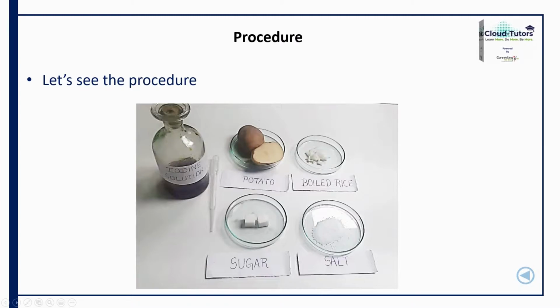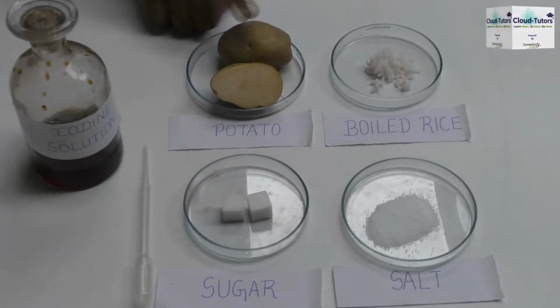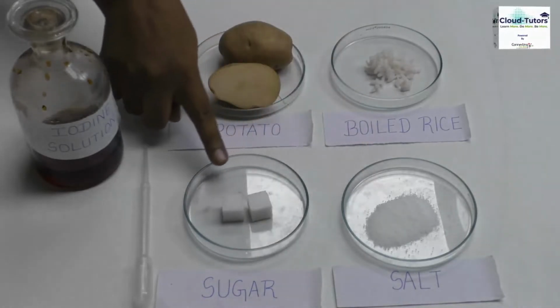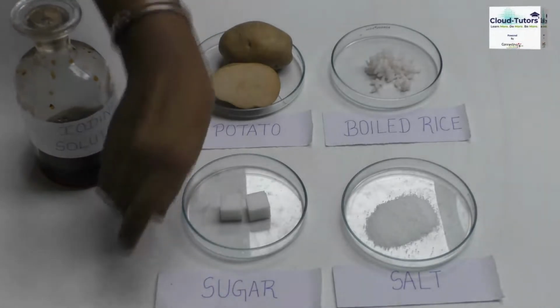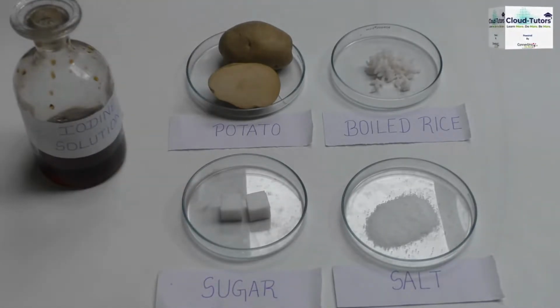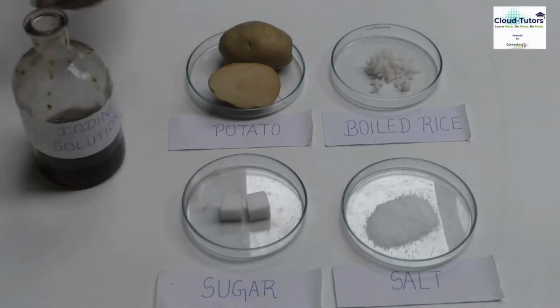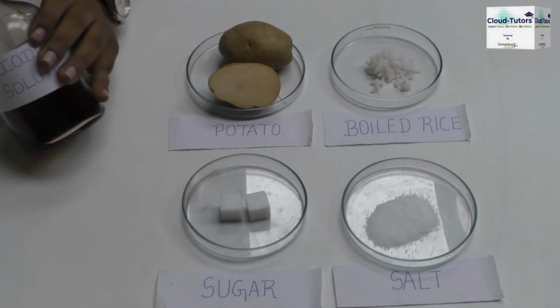We have set up all the given materials in order. So as you can see, I have arranged all the necessary things. We have taken boiled rice, potato, salt crystals and sugar cubes. We have iodine solution with us, and to help drop it onto the given food items, we have a dropper. So first we will test our normal food items like salt and sugar.